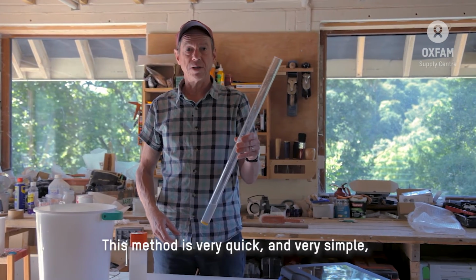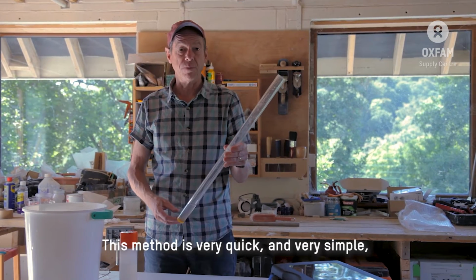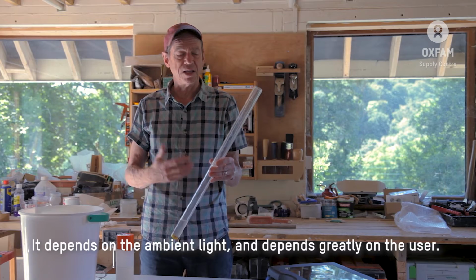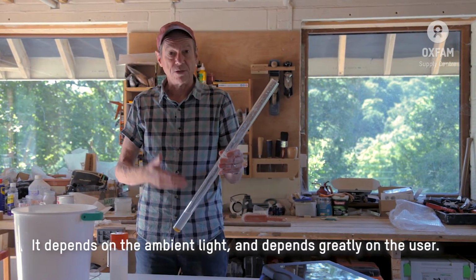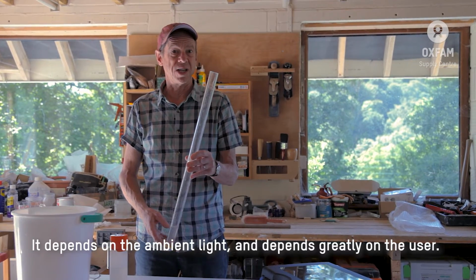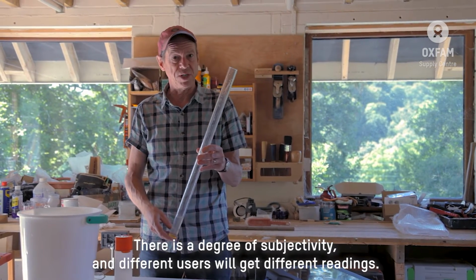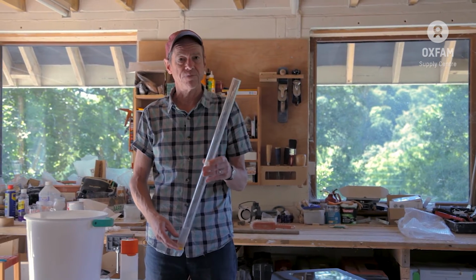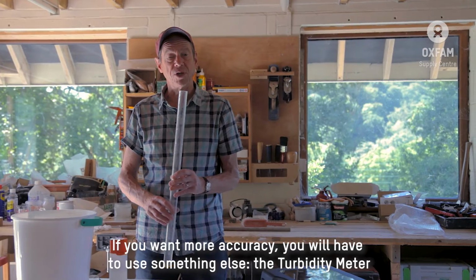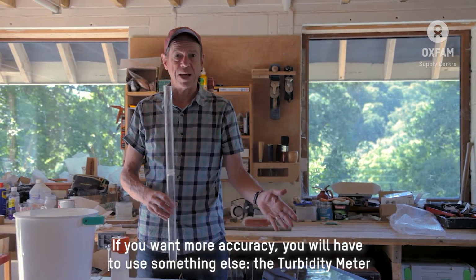So this method is very quick and it's very simple, but it's not very accurate and it's not very precise. It's going to depend on the light that's around you, and it's going to depend greatly on the user itself. There's going to be a degree of subjectivity here, and we'll get different readings. Now, if you want something more accurate, you're going to have to use something different, and we'll come to that, the turbidity meter.